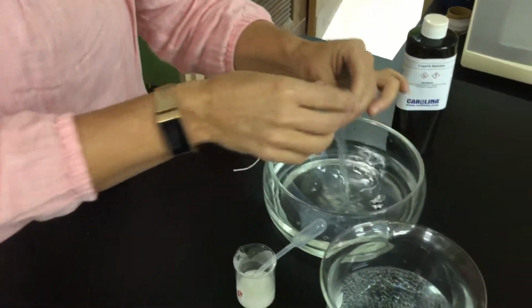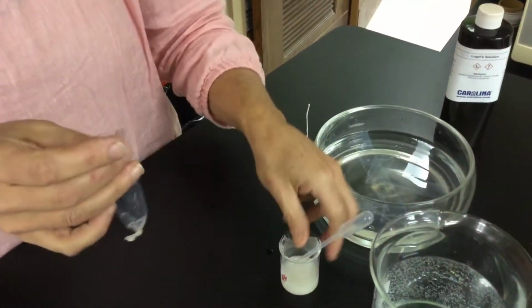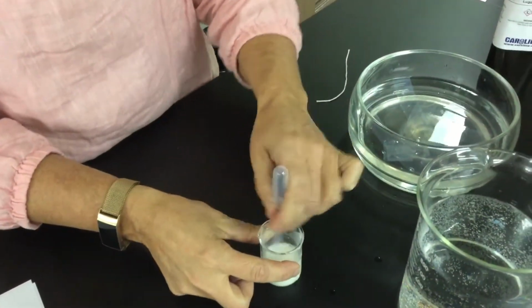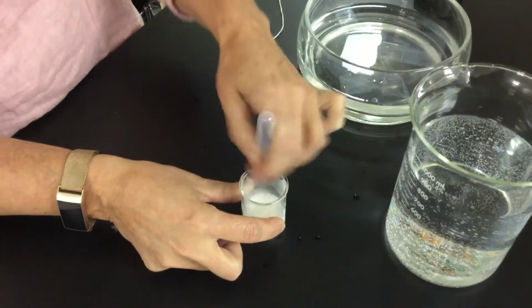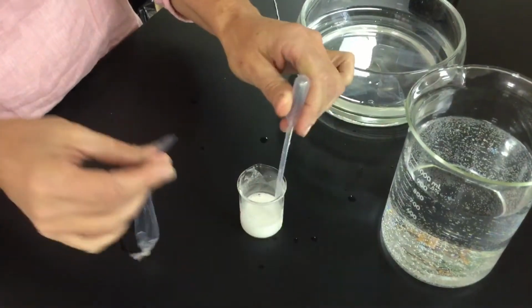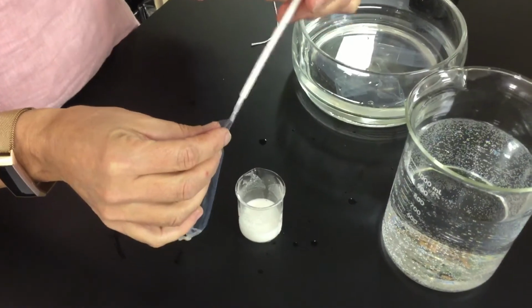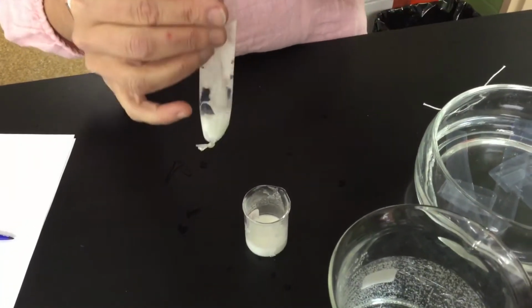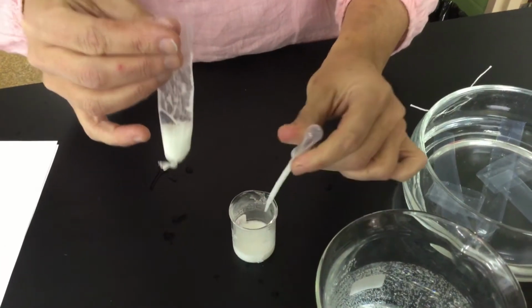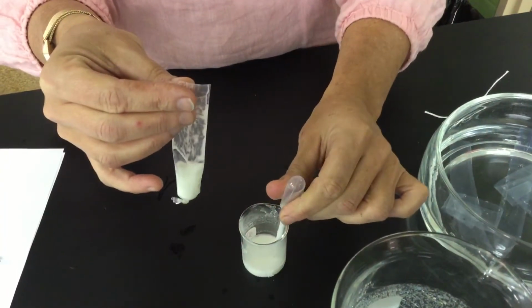You want to make sure that it stays wet, and you want to make sure that you open it up all the way, which is why it's in water. And to that, I've already made this little mixture of water, cornstarch, and glucose. So we have our large polysaccharides, cornstarch. We have our smaller sugar, my glucose, and a little bit of water in there. I'm going to insert it into the baggie. I'm going to put about 15 mLs, give or take, just so you guys can see it's this creamy white color in there. This looks like a flour water mixture. Put a few more for you.